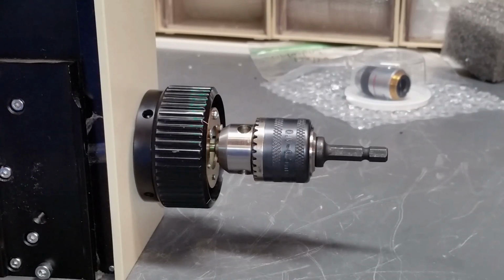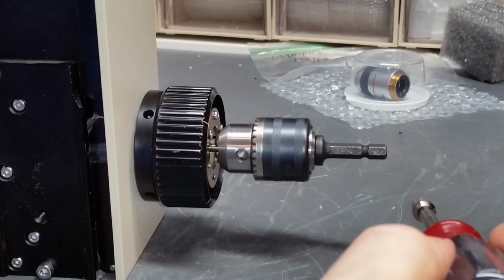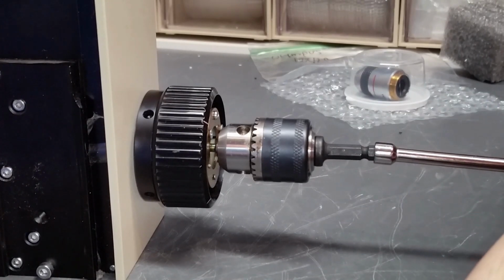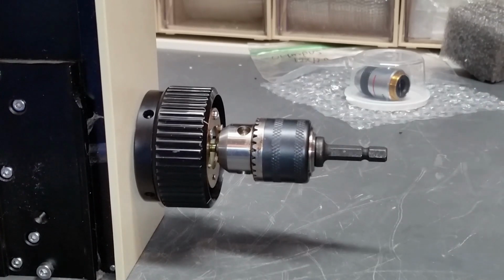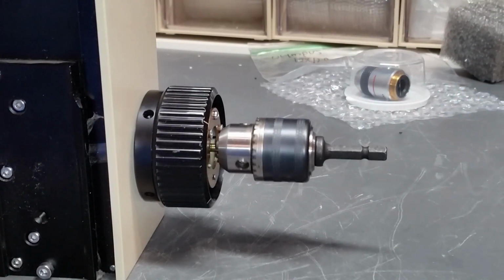So now what I'm going to do is I'm going to rotate this around and watch this end here, and I'm going to rotate it around until it's at its highest position. Right there, I'd say it's about its lowest position. Up there, it's at its highest position. I have a quarter-inch hex tool that I'm going to put over this. And once that's at its highest position, I'm going to just try to move this down a little bit, bend it down until it's straighter. And I don't know, it's hard to say whether it's any better or not, but let's keep doing that a few times, always putting it at its high point, bending it down. And that's definitely better. She's not quite there yet, but it is better.